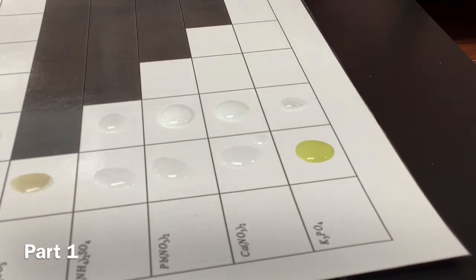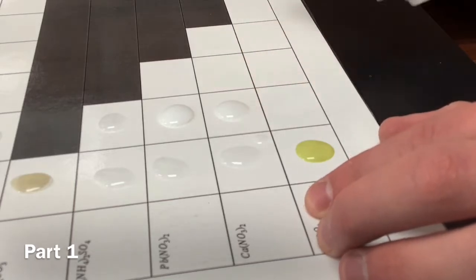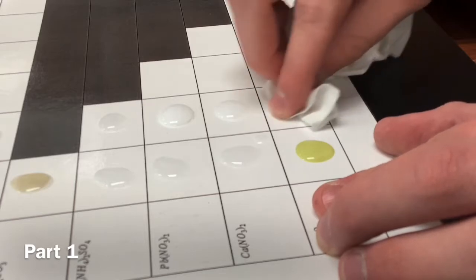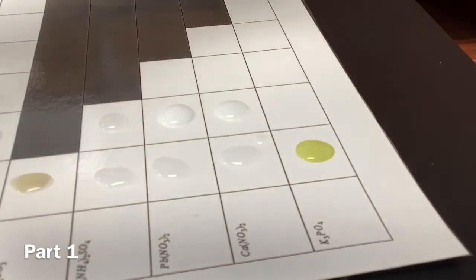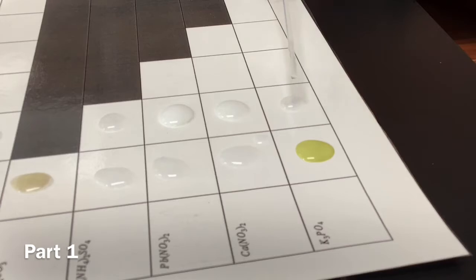It's pretty close. That's the wrong one. All right, guys, I'm dumb, but luckily we have this wipe, so we can undo. Oh, did he do it wrong? Yeah, I totally did it wrong. Oh, that's okay, because the viewers at home are very forgiving. That's the word I was looking for. I appreciate your forgiveness, viewers at home.